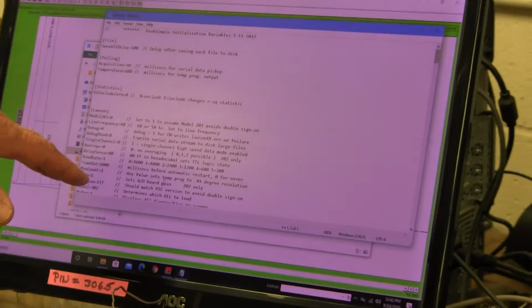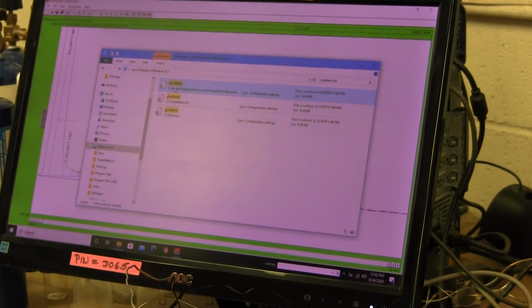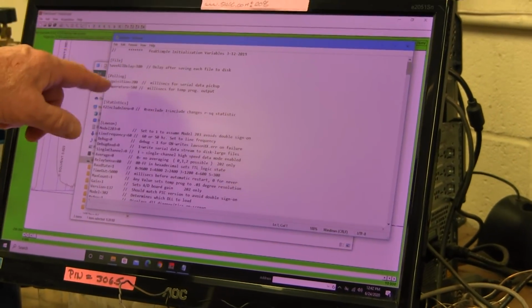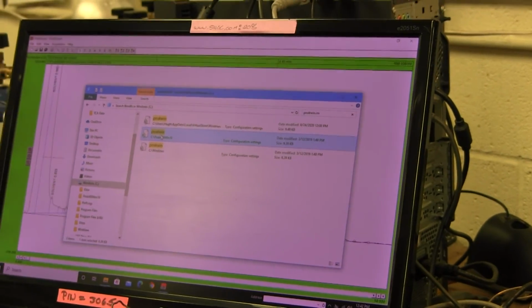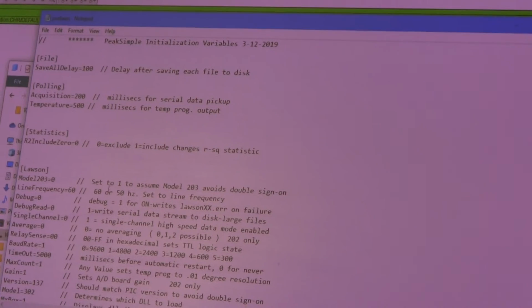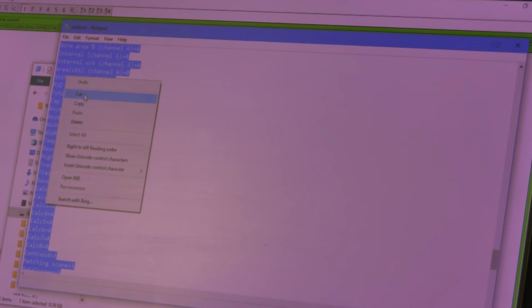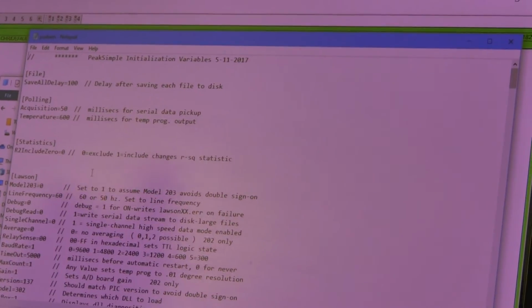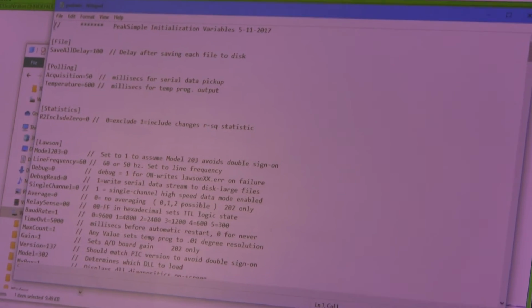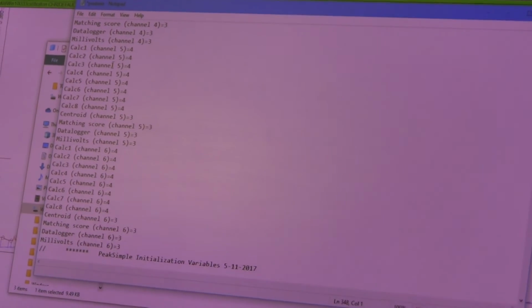And PeakSimple only reads this file when it does first launch. But the file can't be empty. So if the file is empty, chances are good that Windows won't let you just copy a good copy of this. See, there'll be a good copy of this file in the PeakSimple folder, right? In the PeakSimple folder, there's a nice brand new copy of this file. So if you copy the contents of this, to do that, you press Control A, and it highlights everything in the file, and then you right-click and hit Copy, and then you go to the important copy of PEAKWIN.INI, and you go up to the top, and then you right-click and you hit Paste, and then it pastes the contents of the good copy into the bad copy.